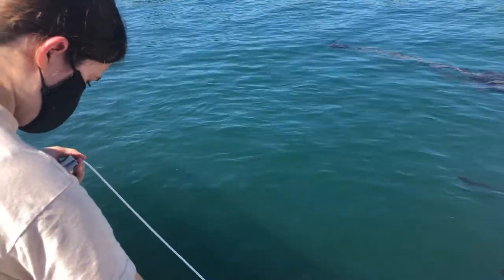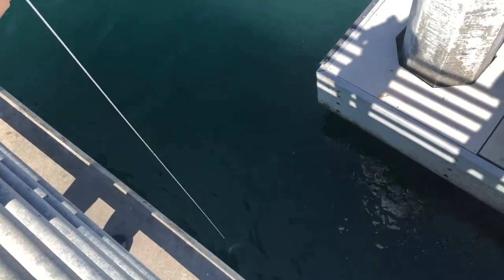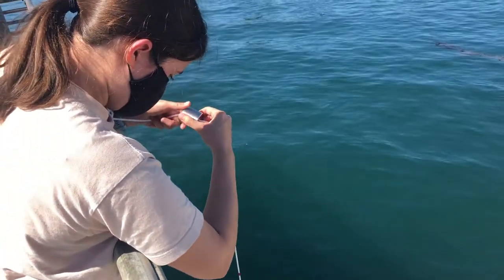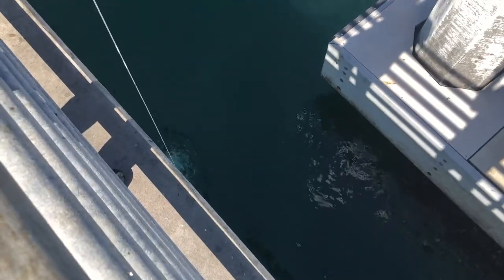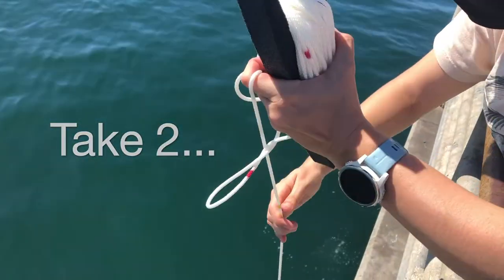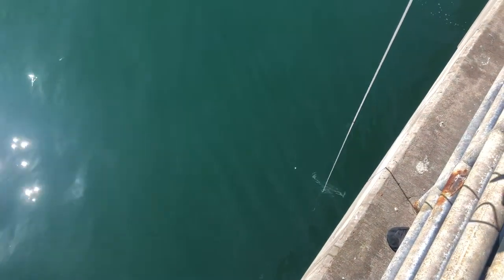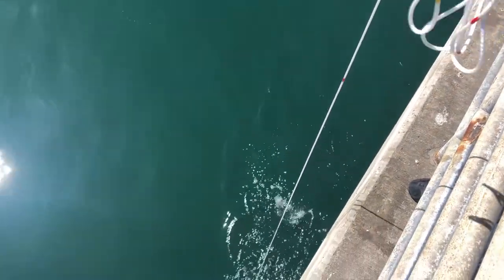Let's say that that's good. There's a little bit of drift here. We want the rope to be really taut so we can let go of the messenger — hopefully it works. I'm going to let go. You should feel a tug when it actually works — and it didn't. It actually worked.